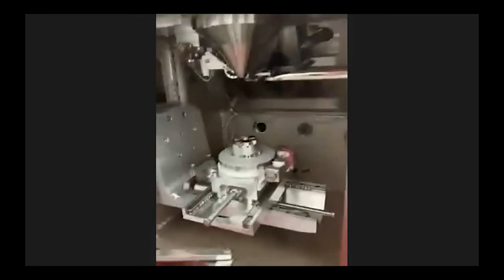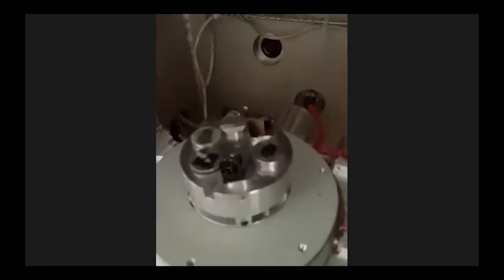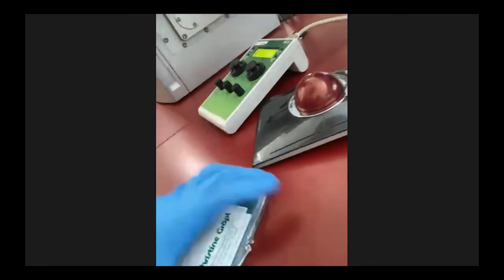I put several samples there. One of them is a holder for transmission electron microscope lamellas. I'm not sure you can see it, but I cannot. The resolution is really bad, so you will see it in the microscope. I will pump the system. Okay, we are back. So I will pump the system and I will show you what the holder for these lamellas looks like.